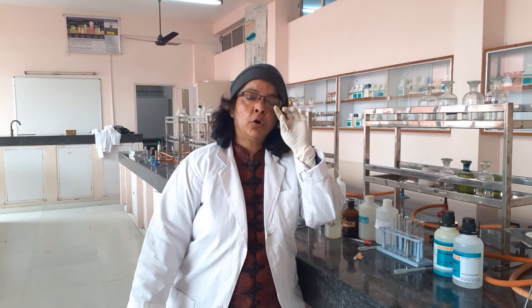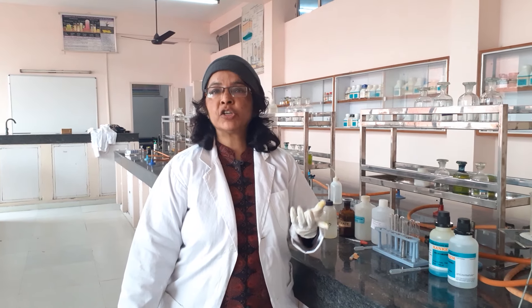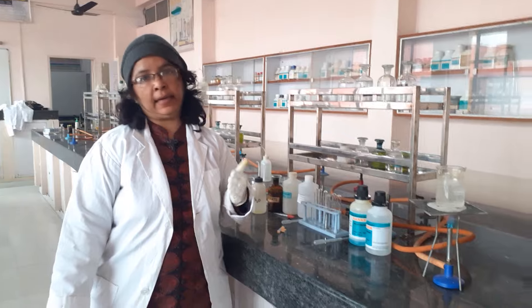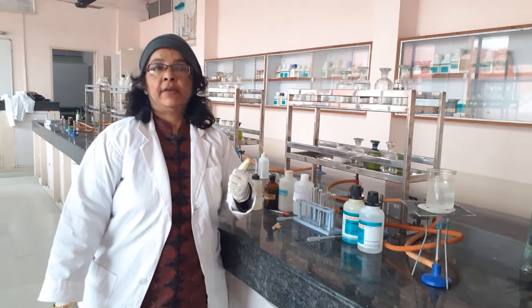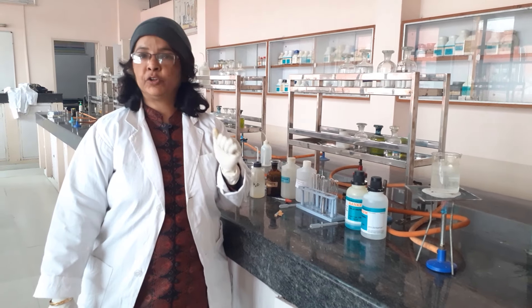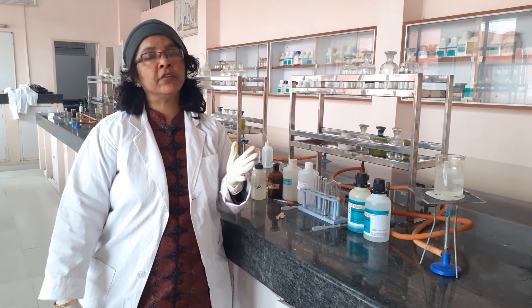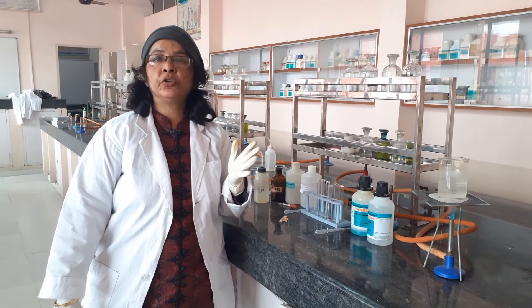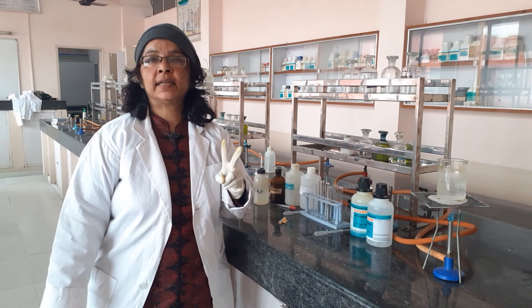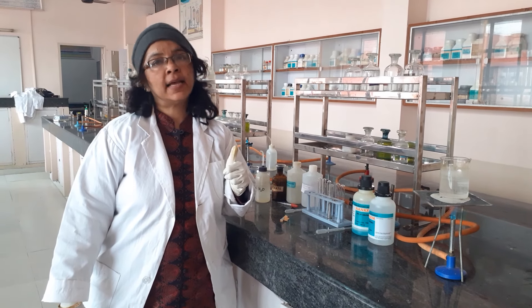Good morning. Moving on with the next functional group for organic practical. Today's functional group is aldehydes. We have already done ketones, and now it is the turn for aldehydes. In your theory, you have done two tests for aldehydes — that is Tollens' test and the Fehling's test.